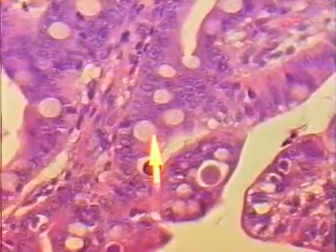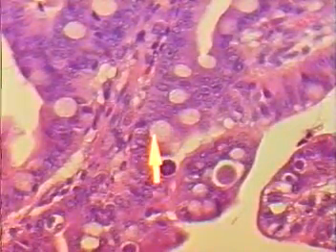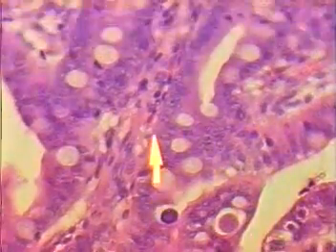At this magnification you should be able to differentiate those from the goblet cells that are present. Most of the rest of the cells you're seeing along here are simply uninfected enterocytes. You won't be able to recognize each and every infected cell — for example, an immature stage would not be possible to differentiate in terms of its developmental stage. Don't worry about each and every one, but you should be able to recognize the obvious ones.